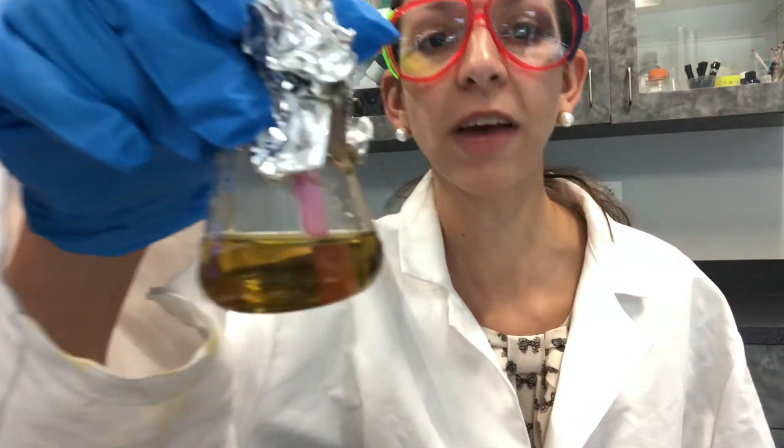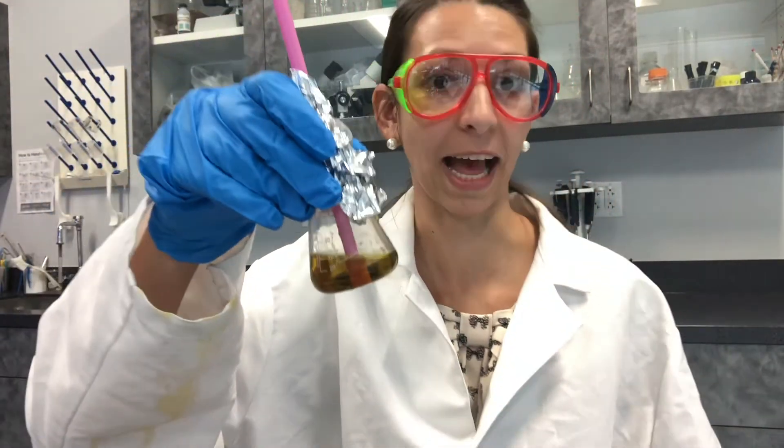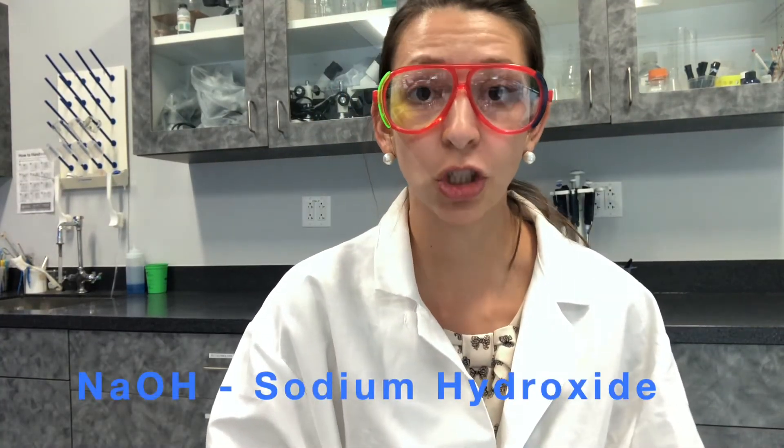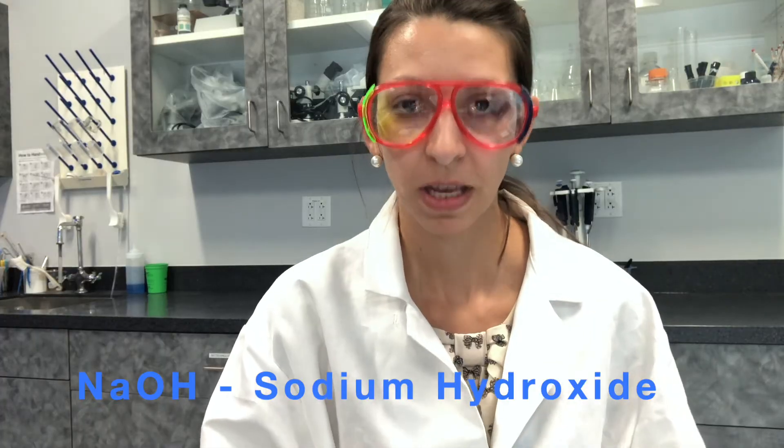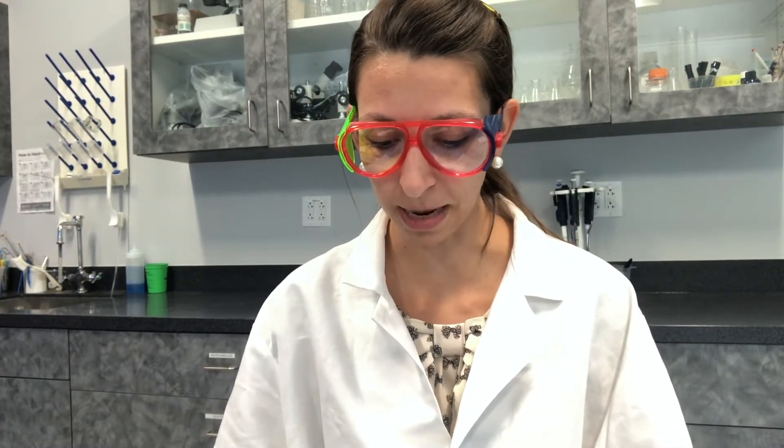All right, that's our one minute timer, and you can see what happened. We have a pretty decent color change to yellow, which means there is acid in this solution. Now it's time for our measurement portion. We're going to be adding sodium hydroxide, or NaOH, to our solution and counting the number of drops it takes to turn our solution back to our original bluish-green color. The number of drops is going to be the data point that we'll put in a data table.